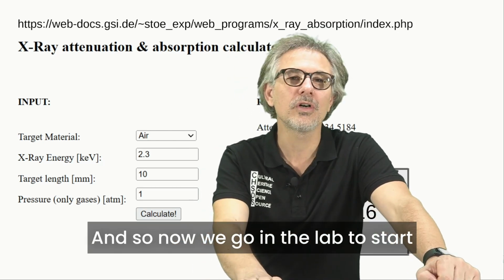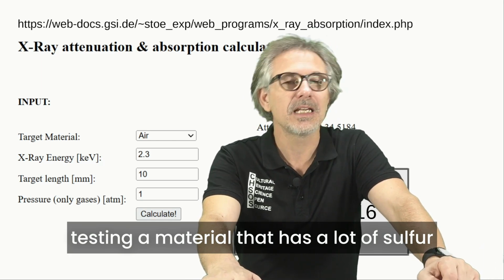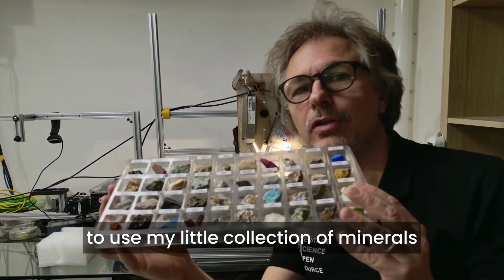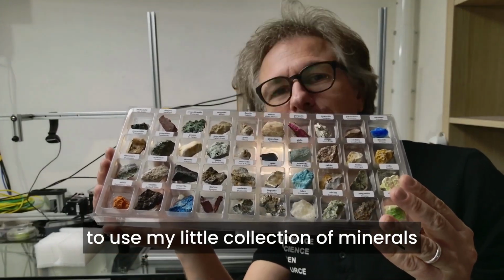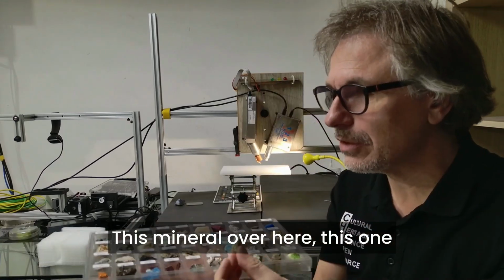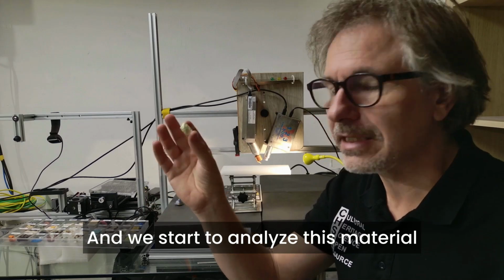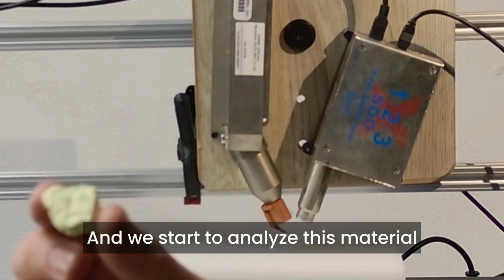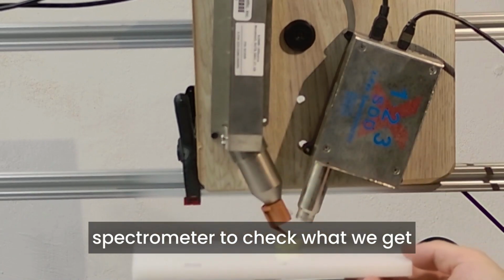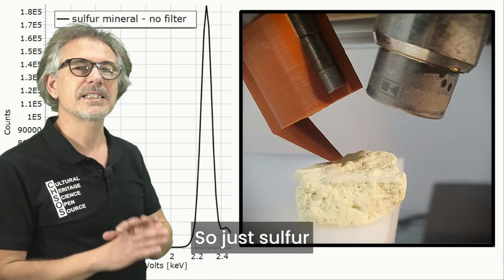And so now we go in the lab to start testing a material that has a lot of sulfur. For the analysis of sulfur, we are going to use my little collection of minerals. So we have sulfur, this mineral over here. This one is actually found in Sicily, and we start to analyze this material. So we put this one under the spectrometer to check what we get.